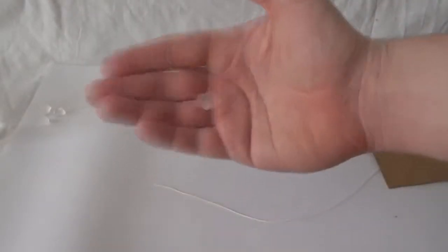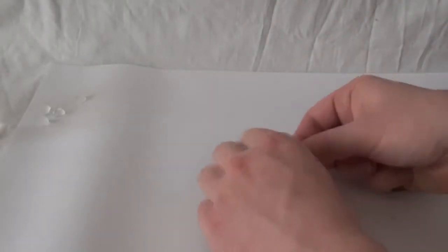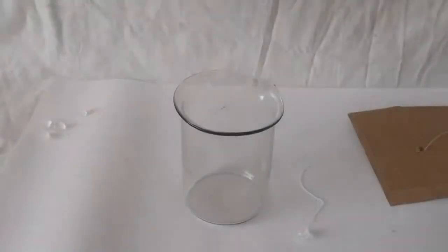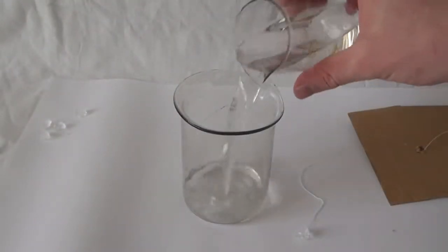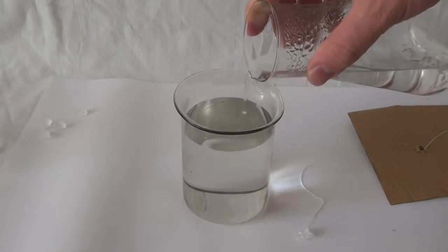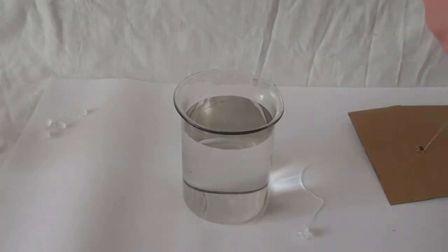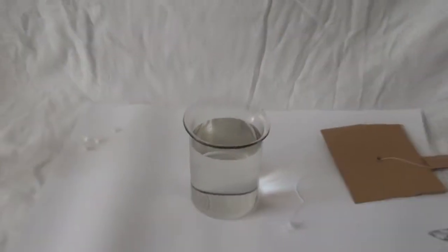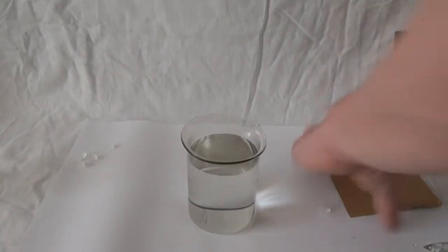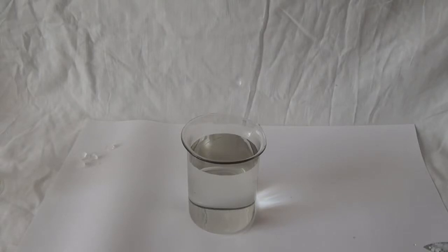I could also advise you to use a thin fishing line instead of thread. Once we have tied a crystal to a beaker, we pour our saturated solution of salt back there. You can tie a thread to a regular pencil and hang a crystal in a glass using it. However, for myself, I've decided to use a system in which the glass will be protected from dust.